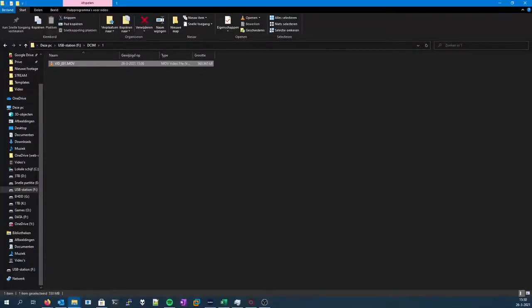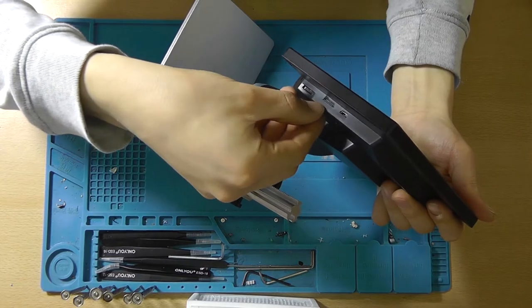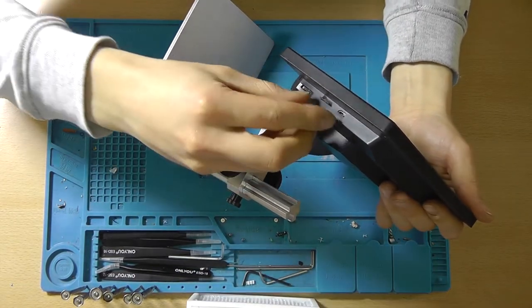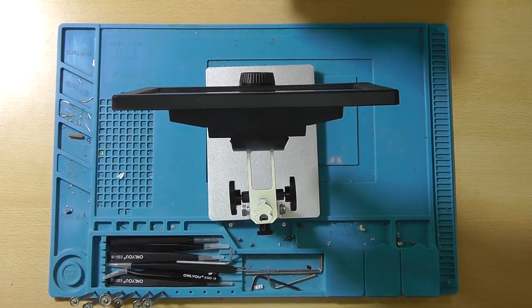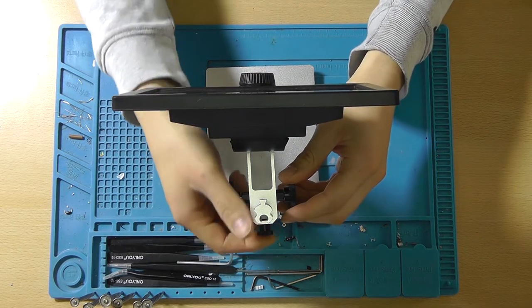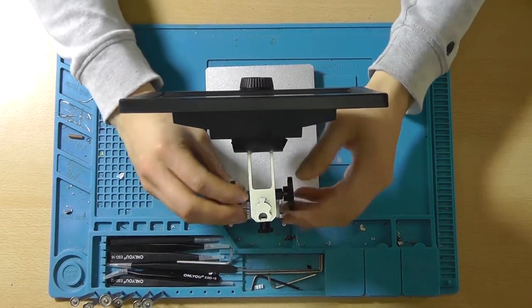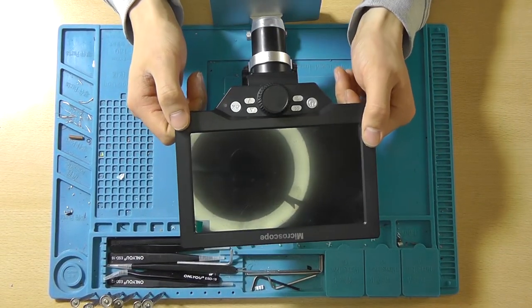Oh, you're able to see the timestamp as well over here in the corner, but I could also just frame that out of the footage. Yeah, I'm quite satisfied with this little mod actually. By the way, I still wanted to give you this little clip of me ejecting the SD card, which works flawlessly now. So guys, that looked great. And yeah, I really hope that you are also going to perform such a DIY upgrade on this little microscope.